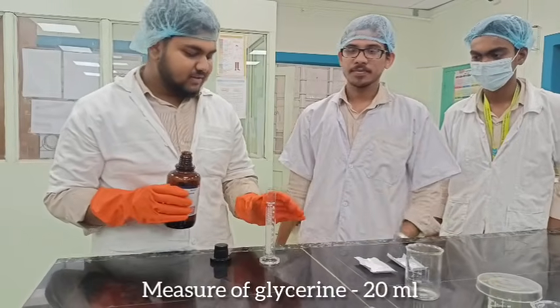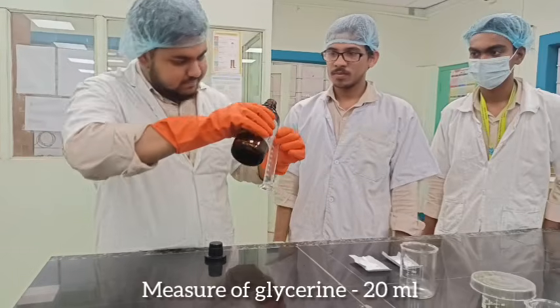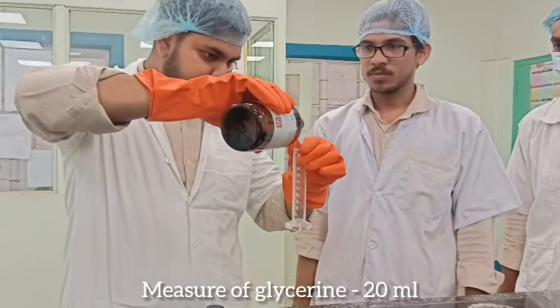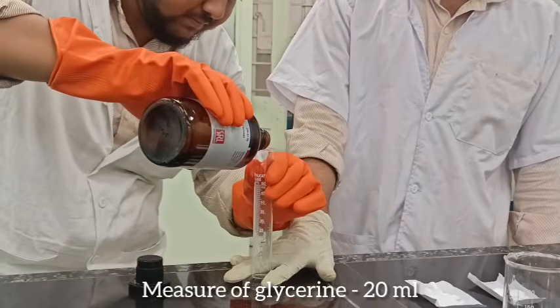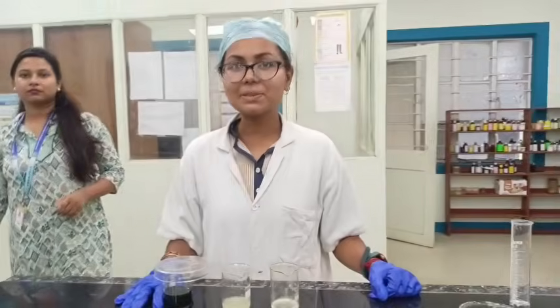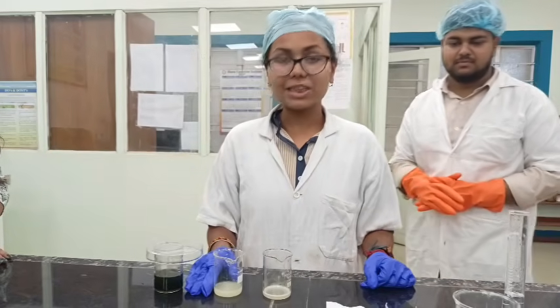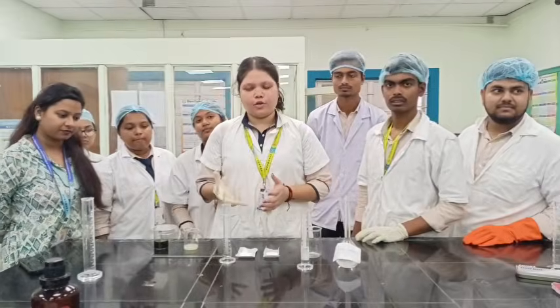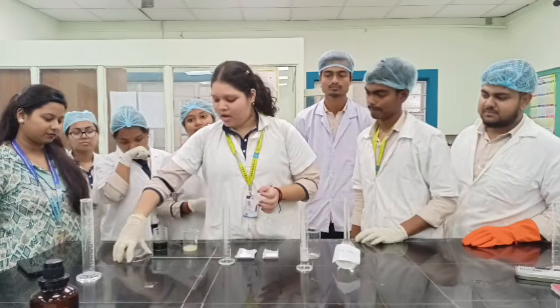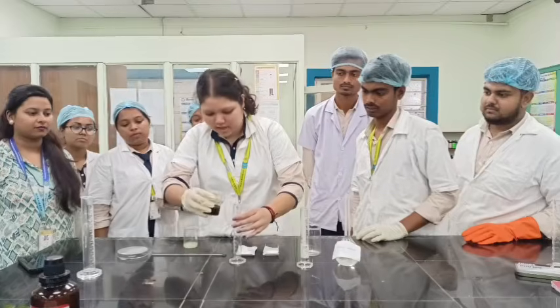Of glycerin. So now we are going to measure this into this measuring cylinder. This one is methanolic extract of neem. This one is lemon juice, which is taken from the lemon, and this one is aloe vera juice. Hand wash. Firstly, we will be needing 20 ml of neem extract, which is methanolic neem extract.